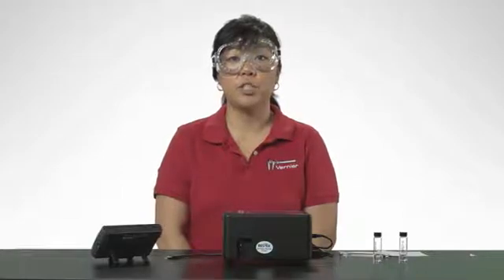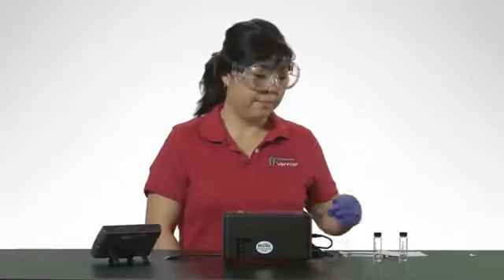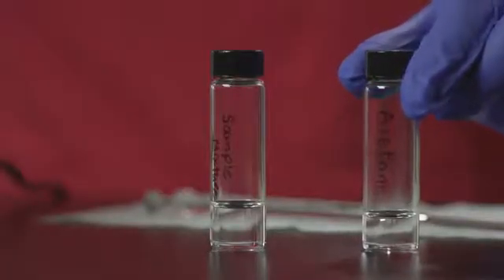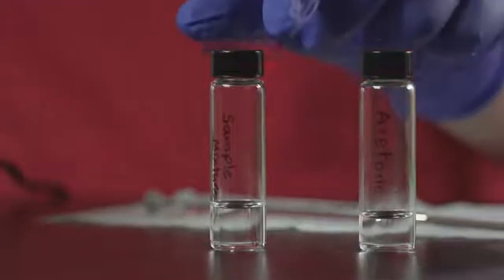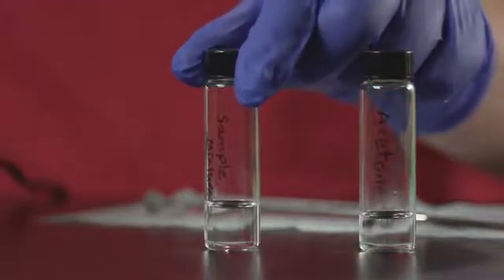You will need a Hamilton 1 microliter syringe, a vial of ethanol or acetone to rinse your syringe, and your sample. A Hamilton 1 microliter syringe is included with the Mini-GC Plus. This rinse vial contains acetone. The sample is a one-to-one mixture of ethanol and 2-butanone.